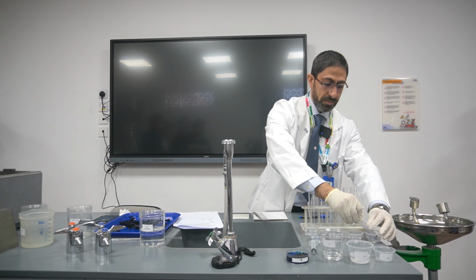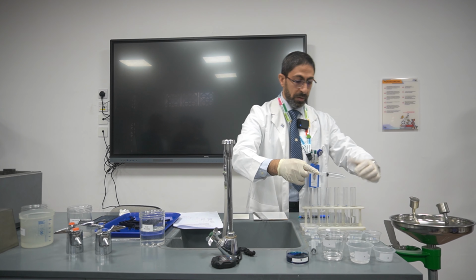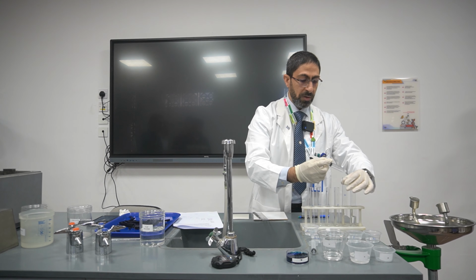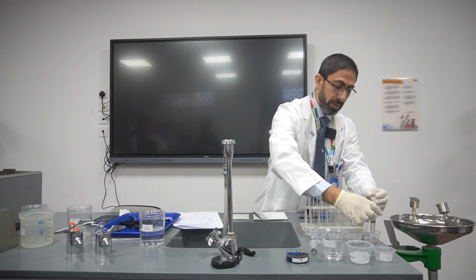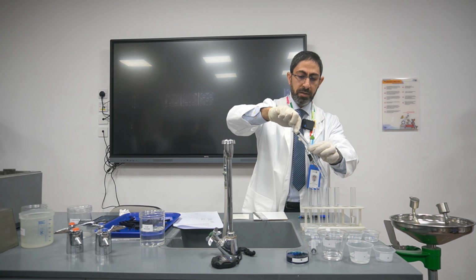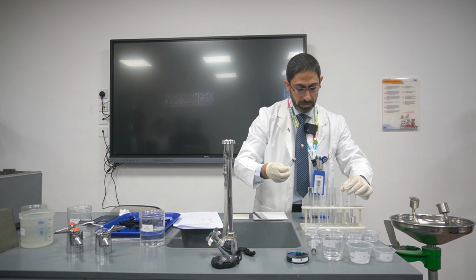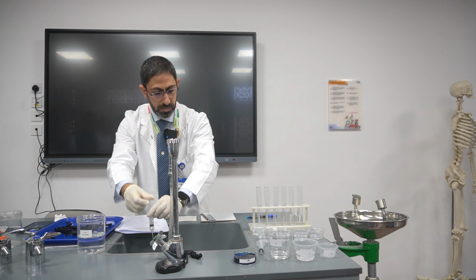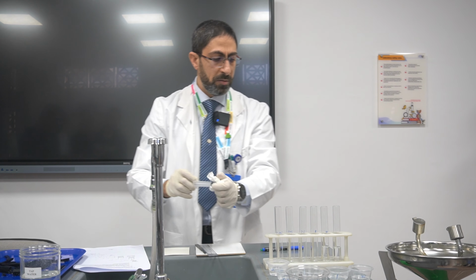Saleh, are we there? Please focus here. Yeah, so here we have 10, it's not perfectly 10. Now it is. So I rinse it in fresh water or tap water. I will clean it to avoid any contamination.